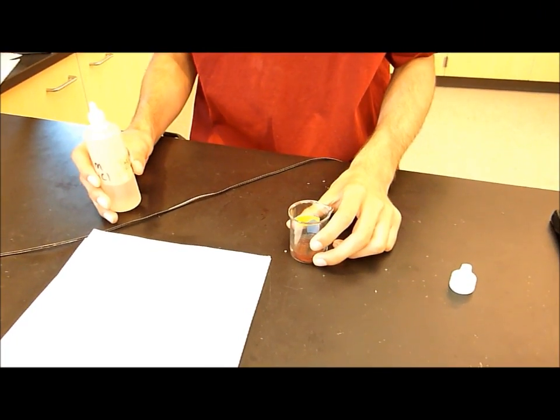The reaction will take about 13 minutes to complete. Once you're done, the solution will be colorless. Most of the elemental copper will be on the aluminum wire.